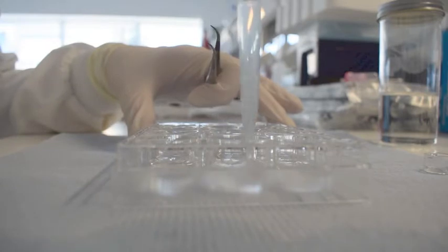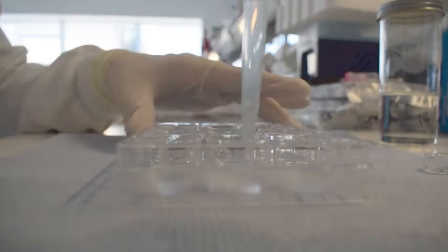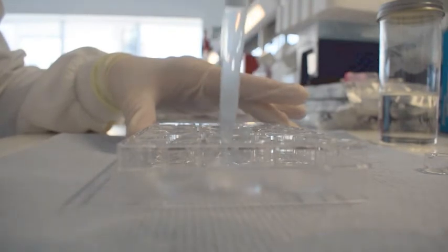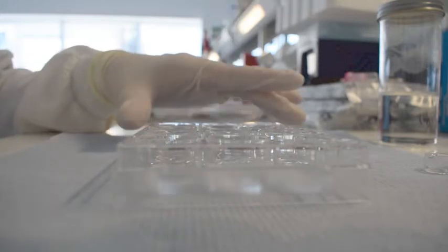The stratum corneum in the well is then washed thoroughly to individualize cells. Following this step, a cell suspension should be generated.